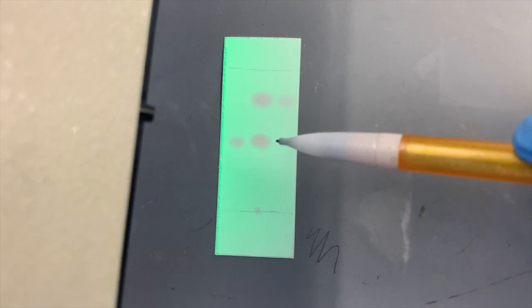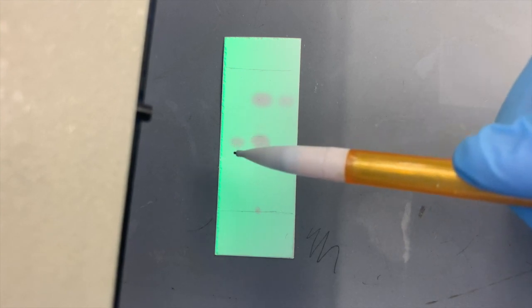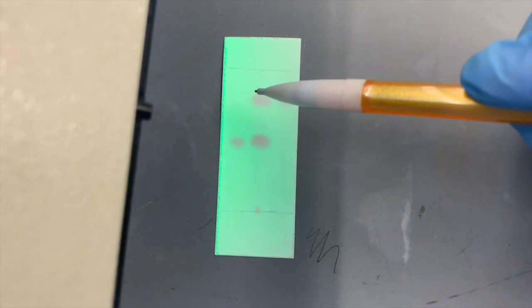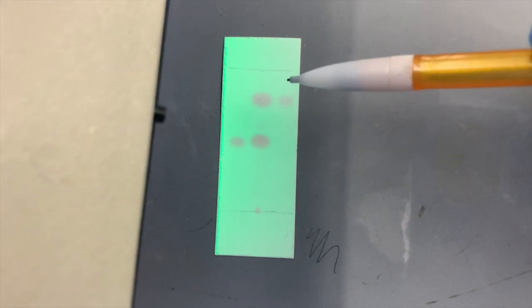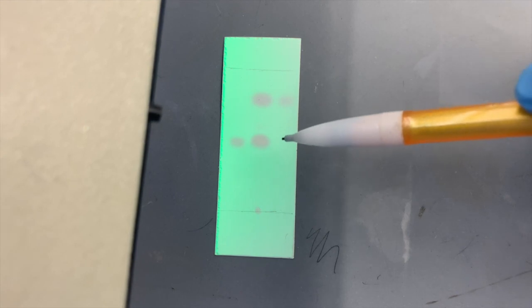Here we go. It turns out that after an hour of reacting, our reaction was not completed. We still have this spot, which is the same as our starting material. So there was still a substantial amount of 2-naphthol in the mixture. So we were not at completion, although we did have a substantial amount of product as well. During that precipitation that we did, we were able to precipitate out our pure product, and we do not see any naphthol in that product.